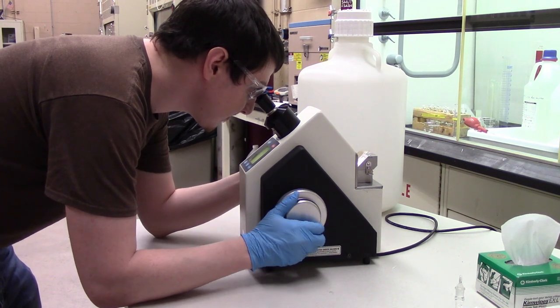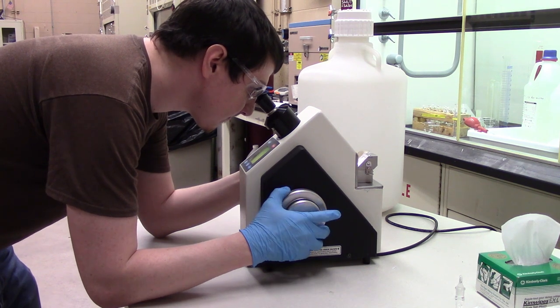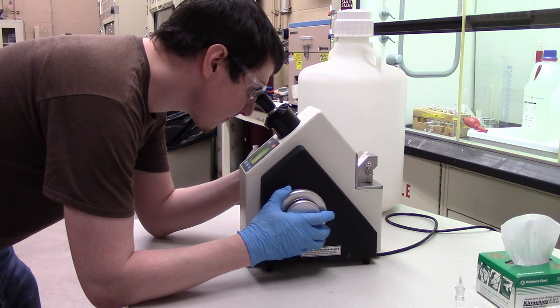Measure and record the refractive index of each standard, following the steps discussed earlier in the video.